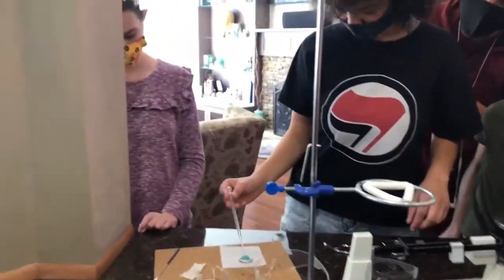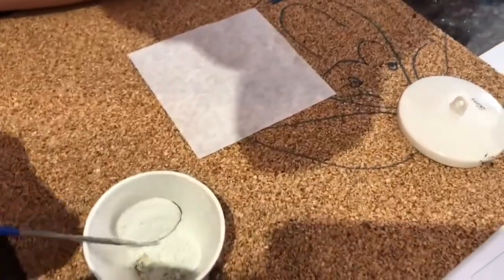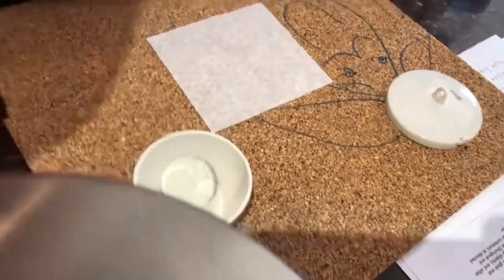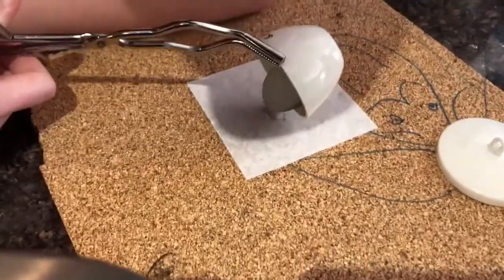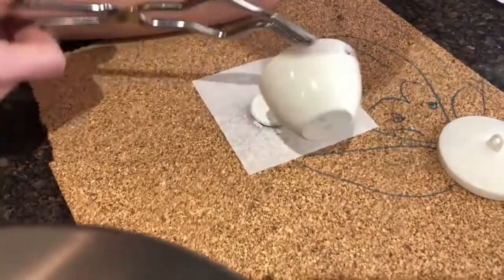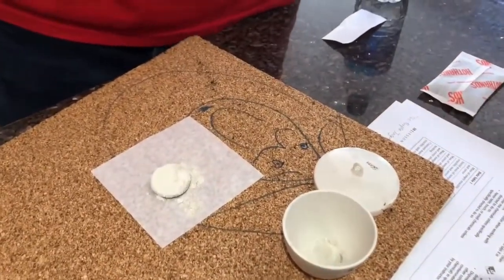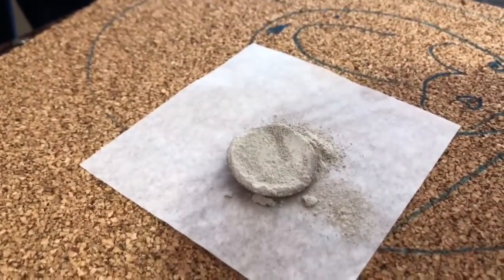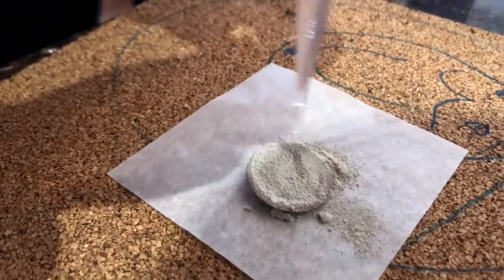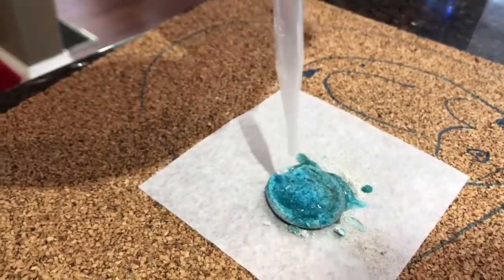Very cool. Chunky in there. You can grab the whole thing or grab a piece of it. The bottom of it turned yellow. It's still hot. Use this and pour it. All right, who wants to do the honors? Just lightly tap a little more water in there with this. Just squirt the water on it gently. Oh, cool. Nice. Good job. It's still warm.